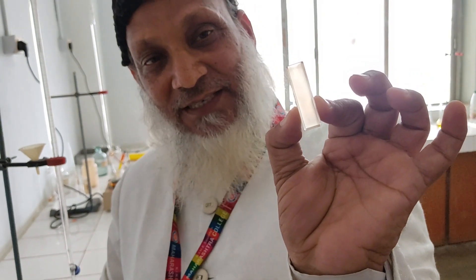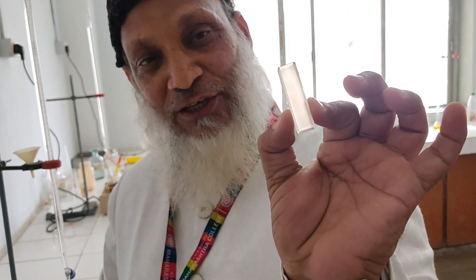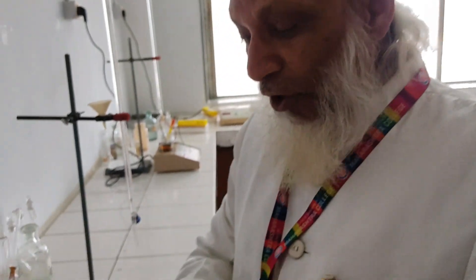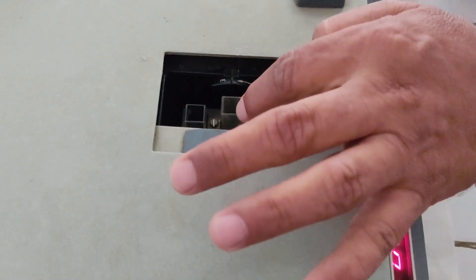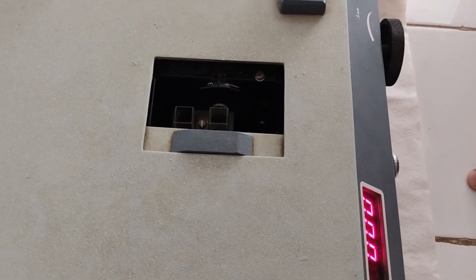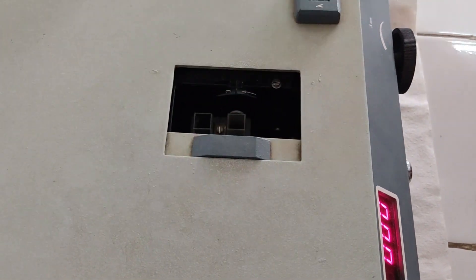You can see this is the opaque part and this is the transparent part of the cuvette. I am putting the opaque part of the cuvette in the first sample compartment, with the transparent part facing the light.